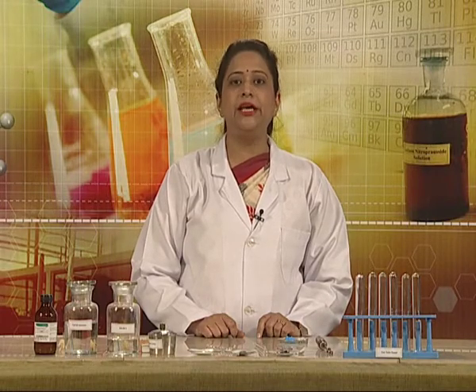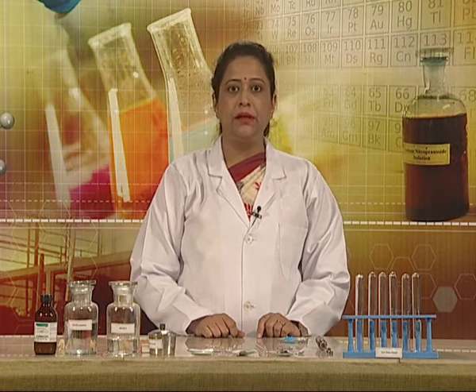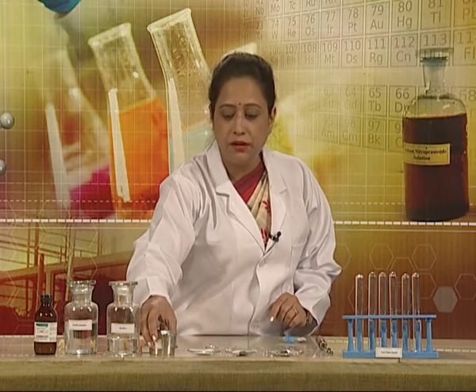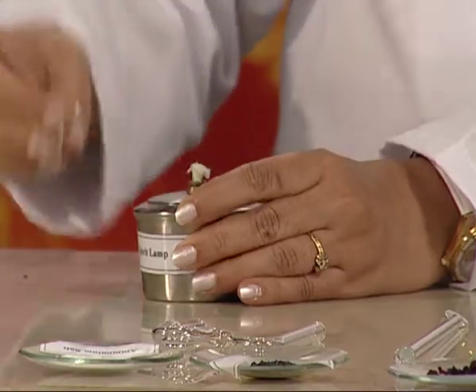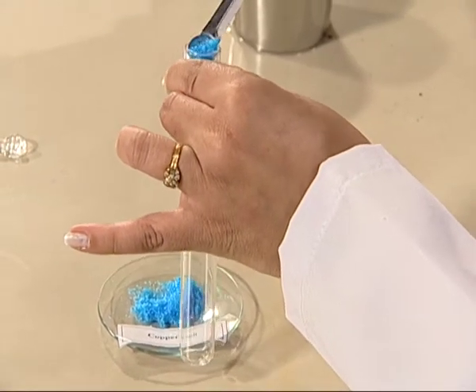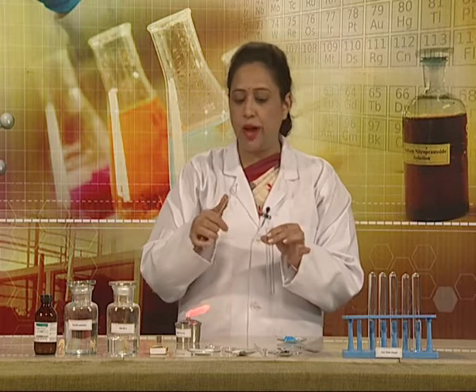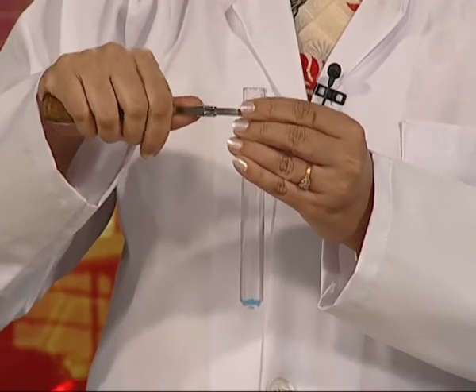Another important aspect of preliminary examination is the dry heating test. Certain salts change color on heating. We will do the heating of a copper salt and observe the change. For this, we require a spirit lamp and take some salt in the test tube with the help of a spatula. We would also require a test tube holder. Grip it and perform the dry heating test.